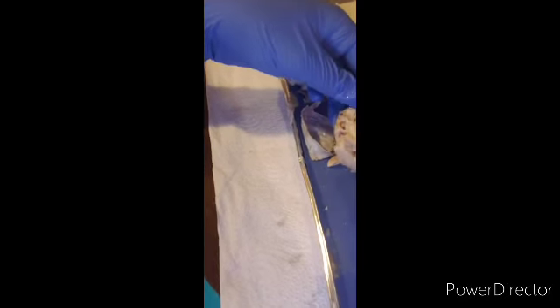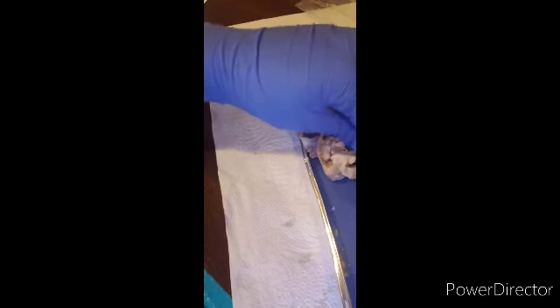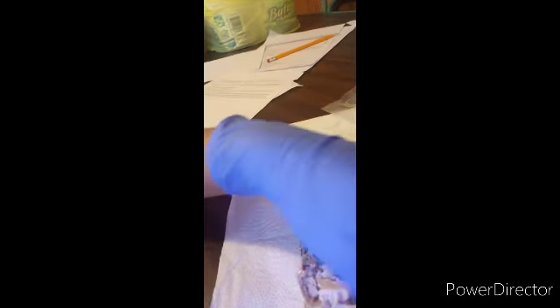Professor, I am very sorry if I'm wrong and I did not cut this correctly, but I did watch the video, but if I did not cut this correctly, I am so sorry. But I believe I did not have a spinal cord with my sheep brain.